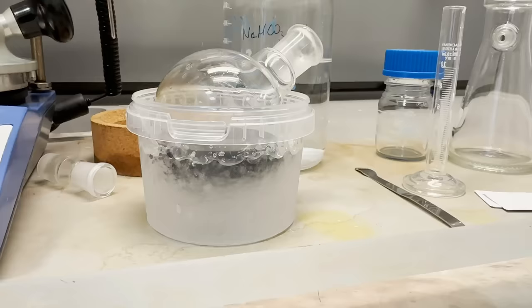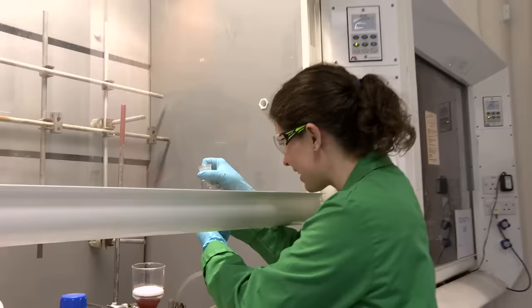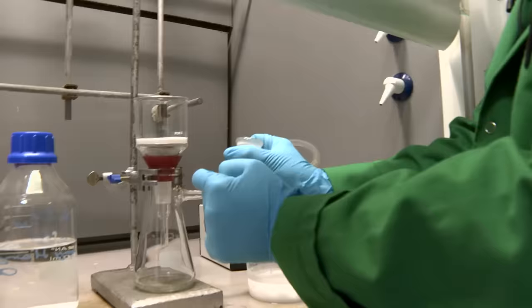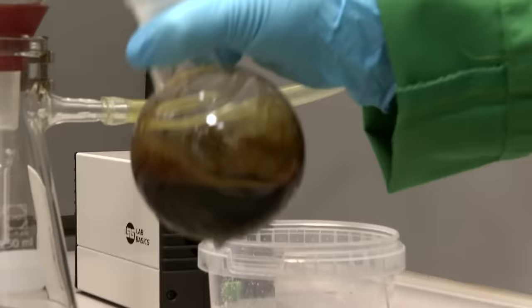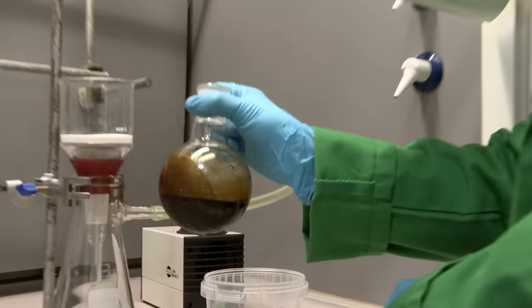It's definitely done something. It's so dark that I can't see how much we have. You can see something has crashed out here where it's been sitting in the ice. So I'd say let's filter it, see how much we have. We're expecting about two and a half grams.